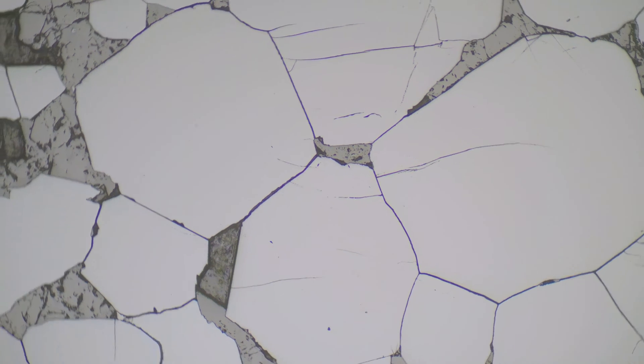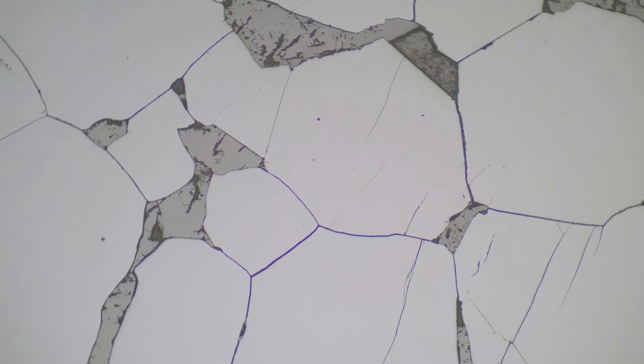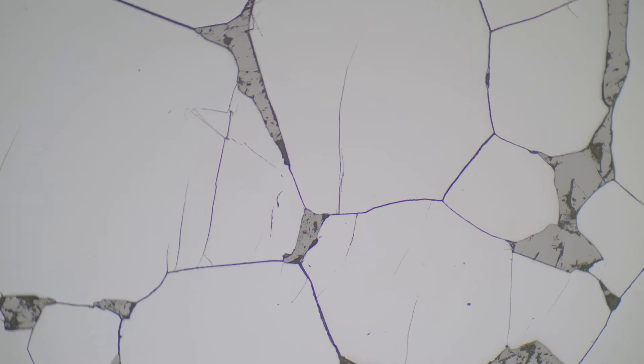The color is gray, and sometimes it can be a brownish-gray color. In cross-polars we're not seeing any reflectance from the sample because it's isotropic — that's because it has a cubic crystal structure so the light doesn't change speed as it enters different areas in the crystal. One other thing is that chromite tends not to have any twinning present. It's a hard mineral with a fairly gray color, sometimes a little bit brownish, and again it's non-pleochroic and isotropic, so it doesn't change color in plain polarized light and there's no light coming off in cross-polars.